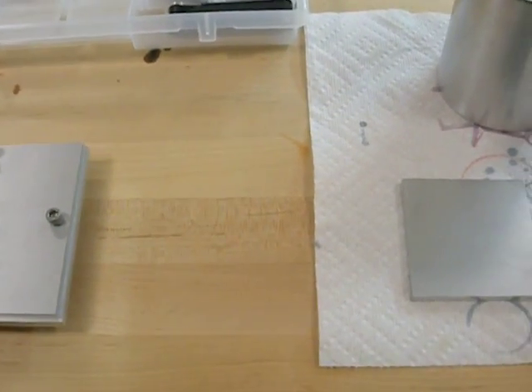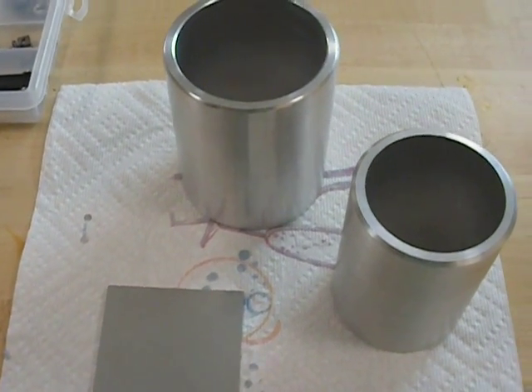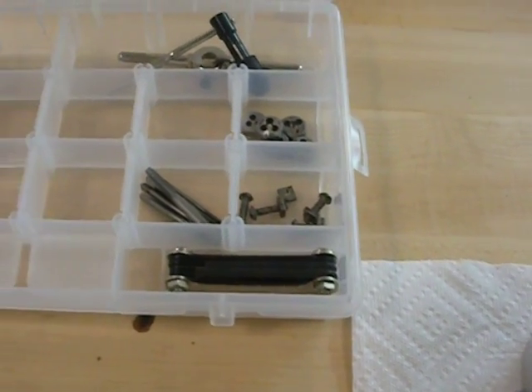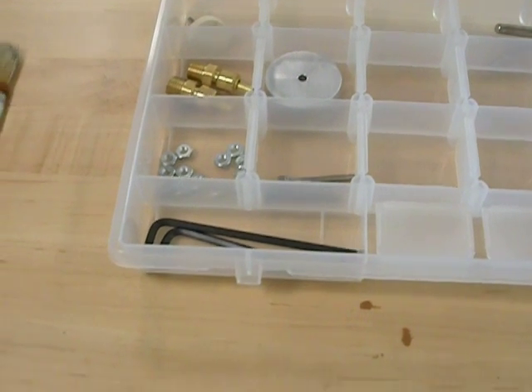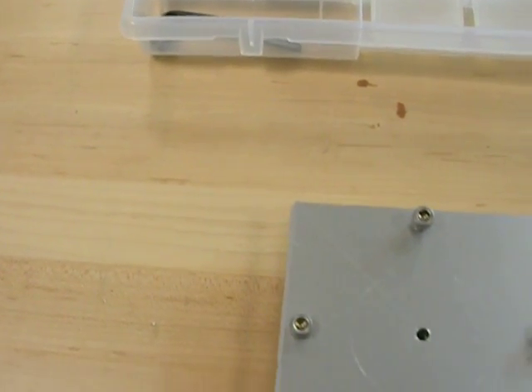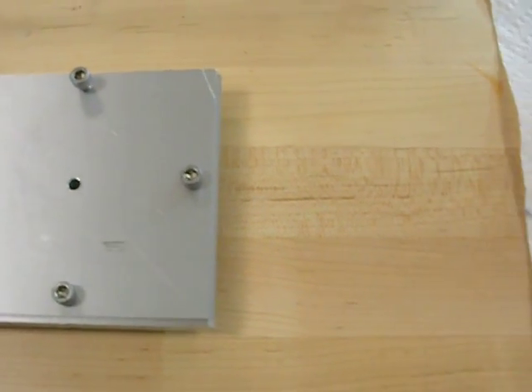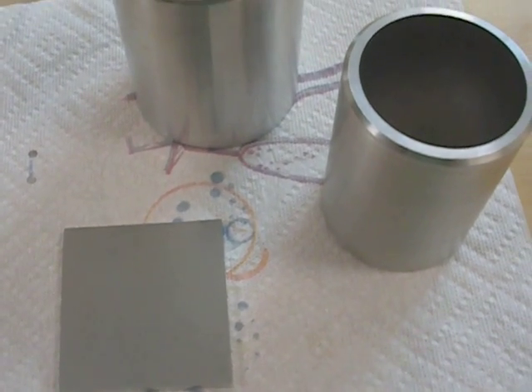This is the preliminary design of a pressure vessel that will be used in the lab to generate anything requiring high temperatures and pressures, without having to buy a stainless steel one for several thousand dollars. The materials cost about thirty dollars from a local metal supplier.